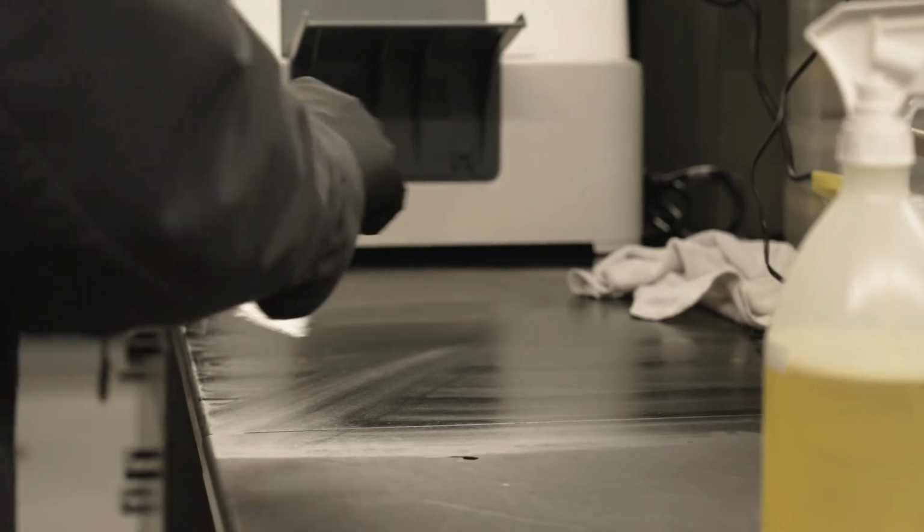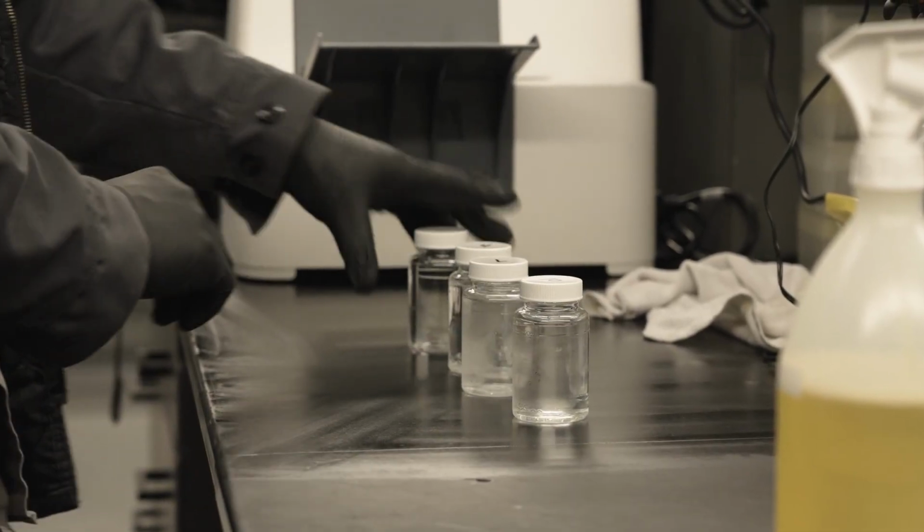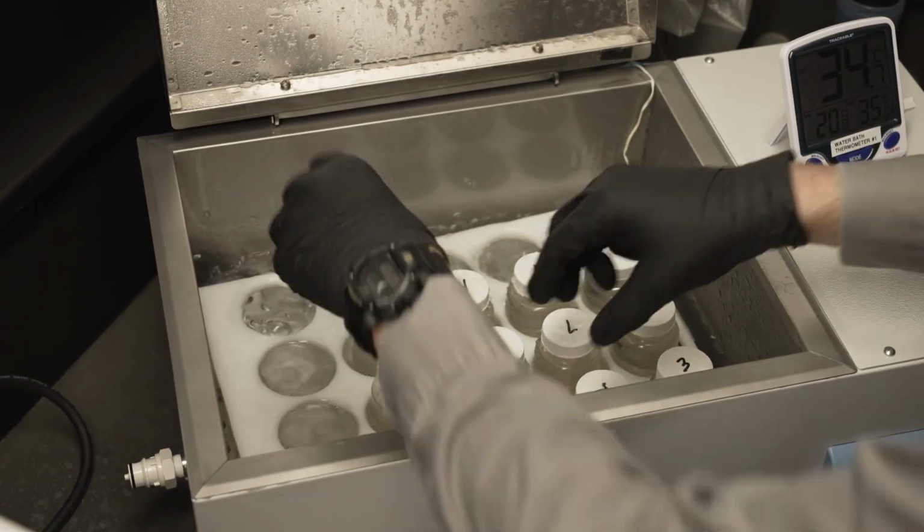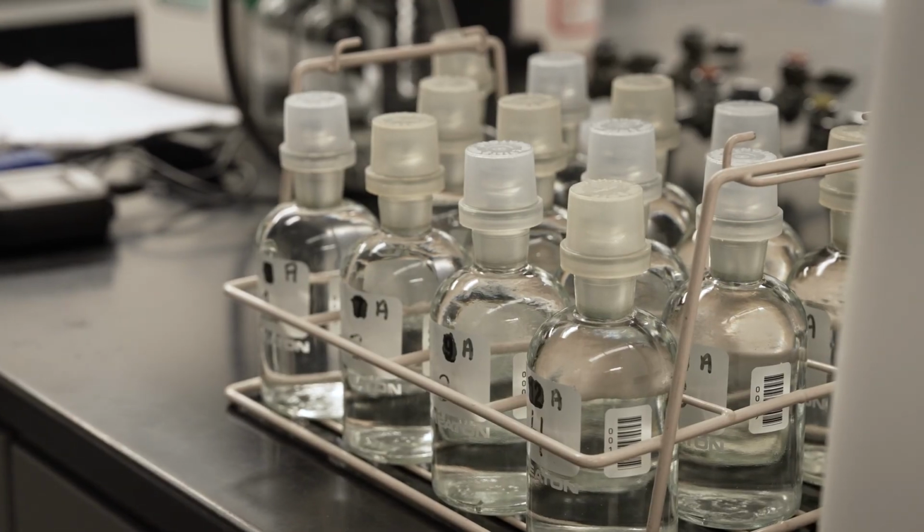We test for all sorts of parameters in different parts of the treatment process and the recycled water leaving the plant. Some of the primary things we test for all the time are bacteria levels, especially coliform bacteria and E. coli, the amount of solid matter in the water, levels of various dissolved salts, nitrogen levels, and oxygen demand.